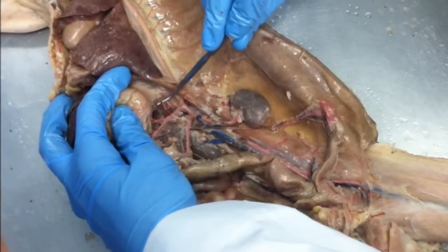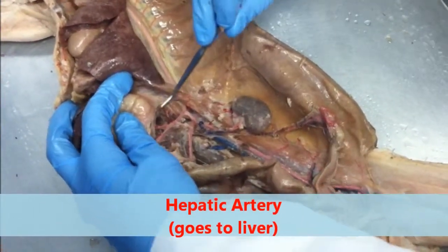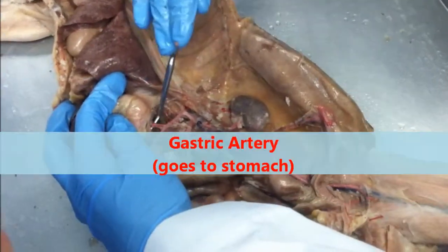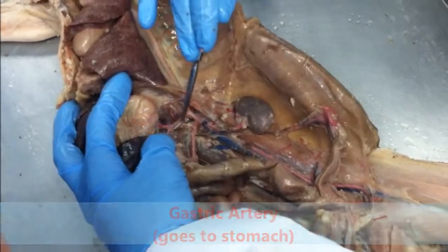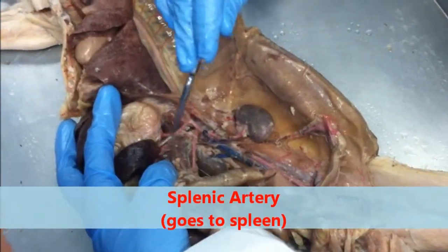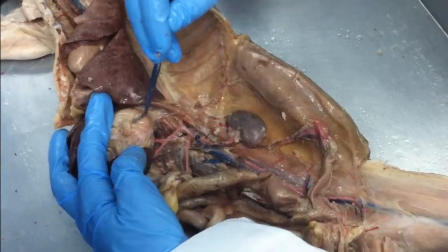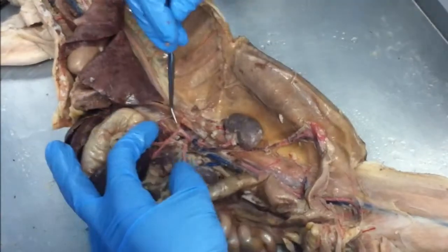The hepatic artery goes to the liver, first one. Second one goes to my stomach, which is the gastric artery. Third one goes down to my spleen, the splenic artery. Celiac trunk splits 3 ways: liver, stomach, spleen. Hepatic, gastric, splenic. Okay?